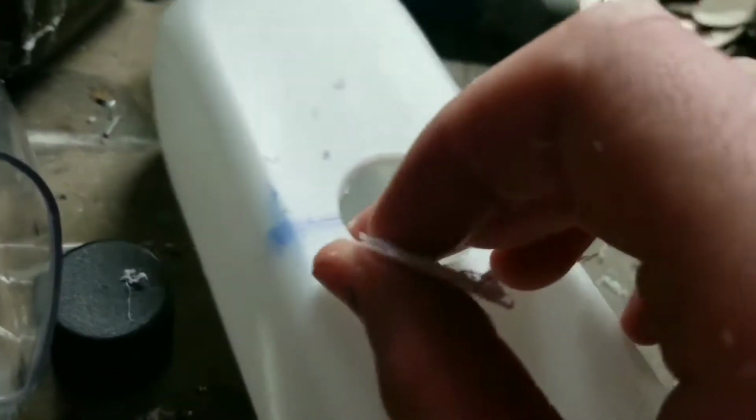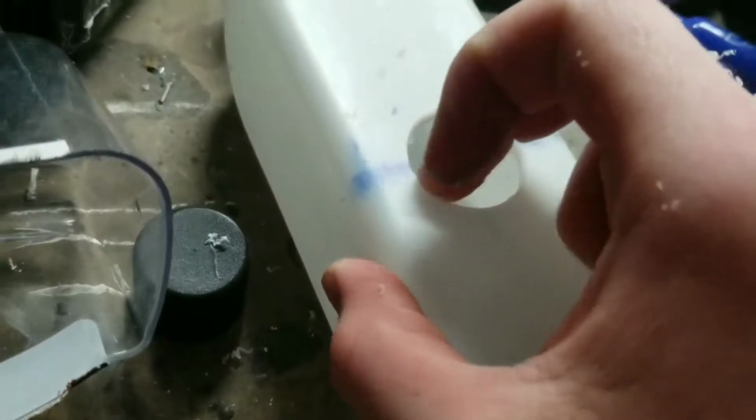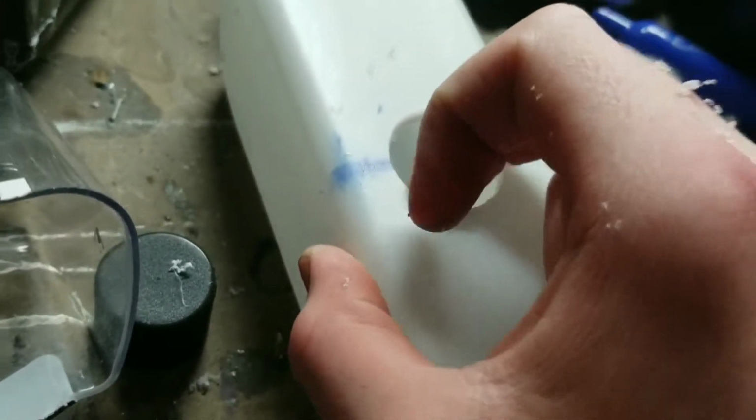So now I'm going to drill with this. Okay, so as you can see, I drilled this thing, and now I've got to get a pipe that fits properly in there. Preferably, you're going to want to use some acrylic pipe or something. I was thinking about just cutting a pill bottle in half, but I don't really want to do that. I'd rather just use an acrylic pipe.